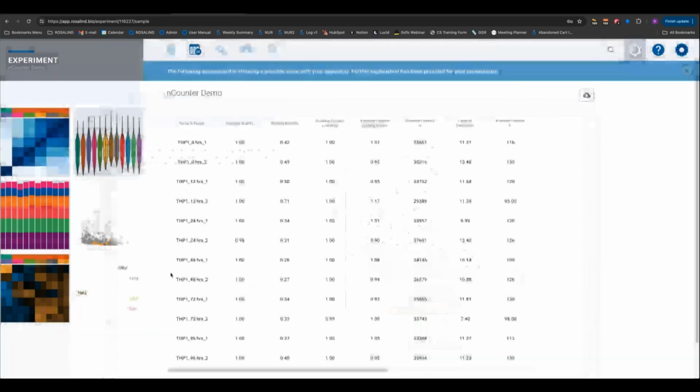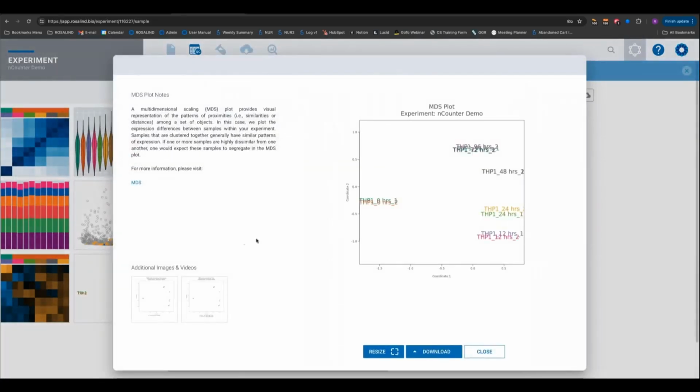And we also have an MDS plot. This is a multidimensional scaling plot. You're reducing the dimensionality of your data set, allowing you to look at the relationships and the similarity between your samples. Very similar in principle to PCA, or principal component analysis. And you can layer on top your different attributes. In this case, we have different time points and different treatments.